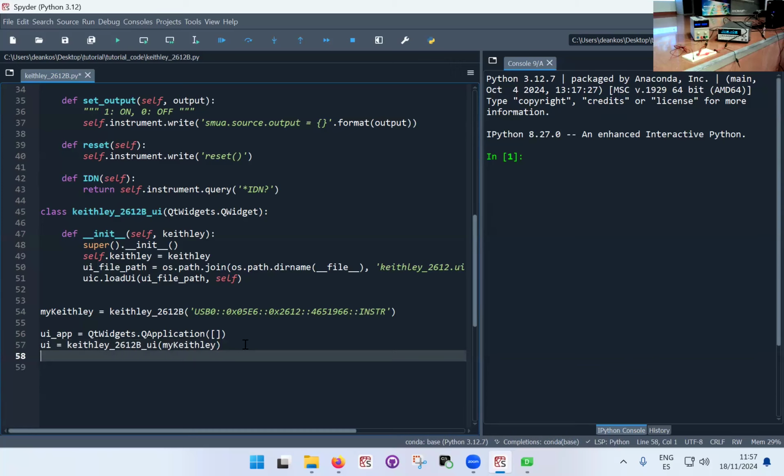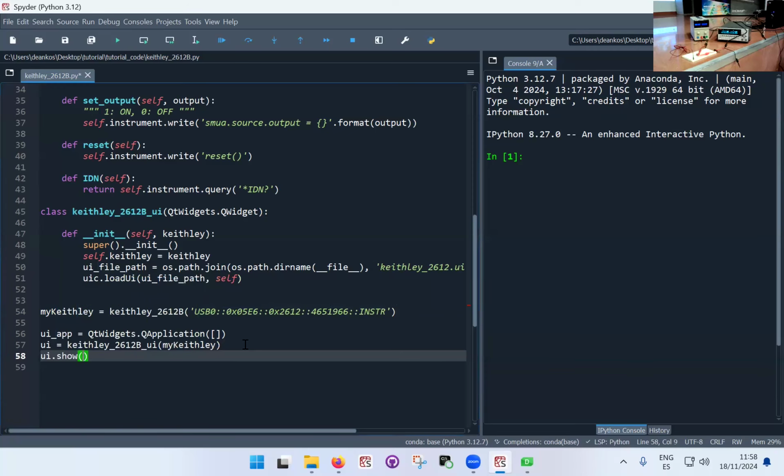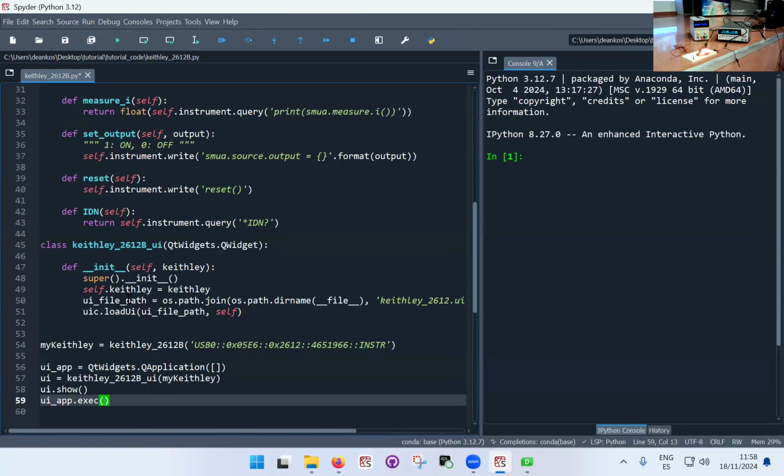Now I have to actually show the interface. This is very trivial: UI.show. The user interface is this. And then finally, this is another step, which is a little bit technical in the sense that it's related to how Qt works: the UI app that I created in the beginning, I have to actually execute it. And that's how it's done. So these few lines are a little bit technical. Just keep them there when you're doing your own thing, and you can go and look what they actually do and why they're necessary.